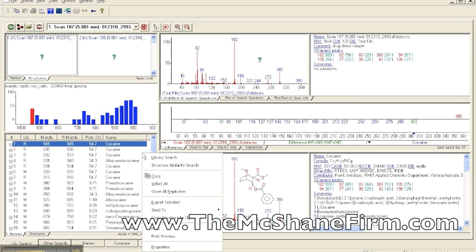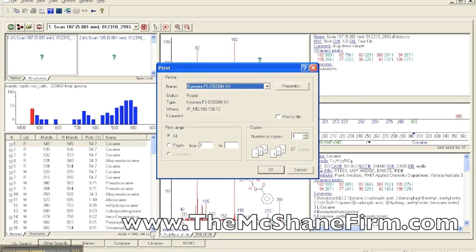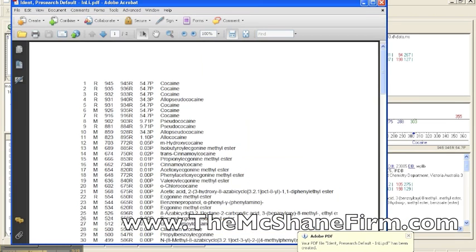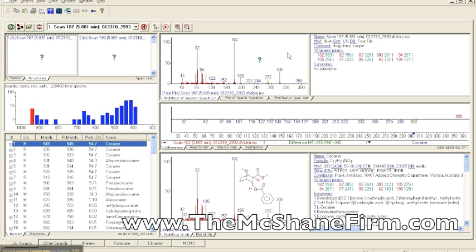So what you can do is right-click on here, and you can print this screen individually. And if you print this screen individually, it'll give you that hit list that you want to see. So here it is. You can see here the different factors that are there. It'll tell you what library it comes from. It'll tell you the match scores. It'll tell you the relative match scores and then the probability scores. So it's actually really simple to do. And therefore, don't let a judge or an analyst tell you that it's too much work, because it clearly isn't. And it's about getting it right.